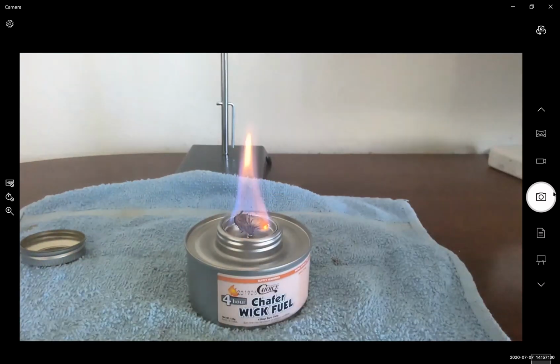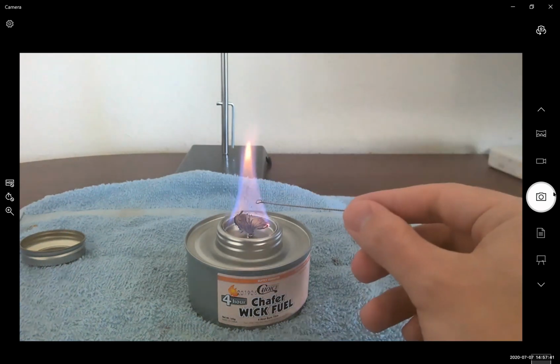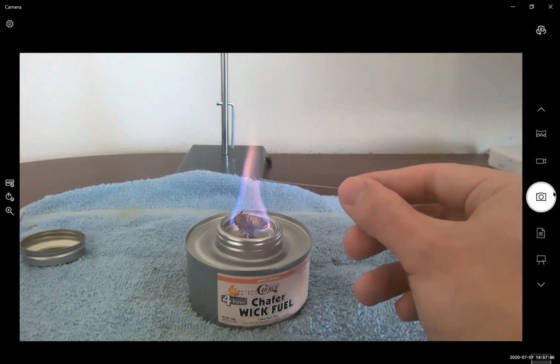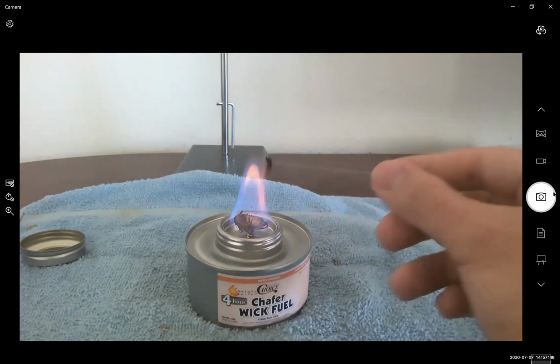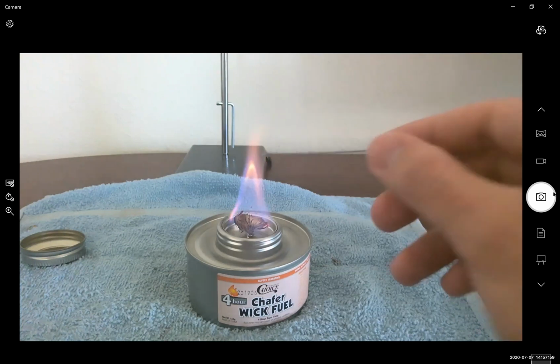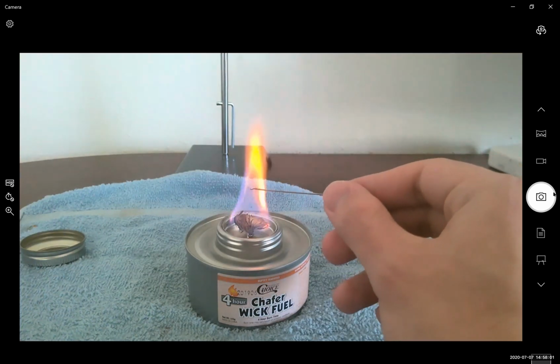It's sometimes very tricky to observe the flame color. Try to notice and look for any distinct changes in flame color. No, nothing yet. This may take a few tries. You should see a very distinct, almost red color.